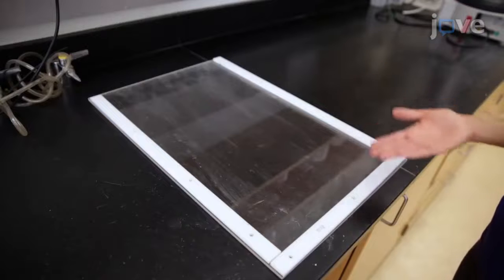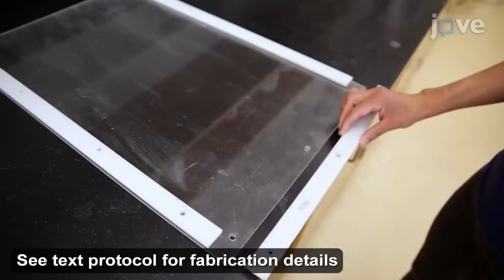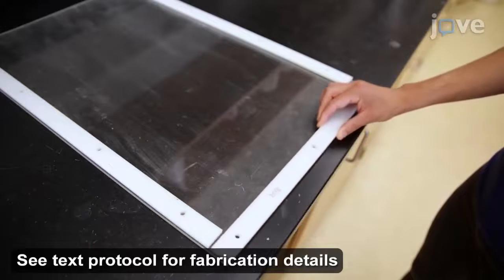At this point there are side and bottom spacers on top of the back panel. The spacers are aligned with previously drilled holes in the panels.